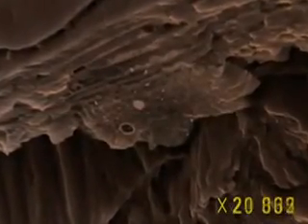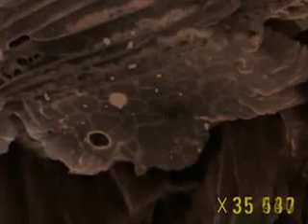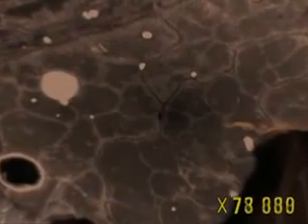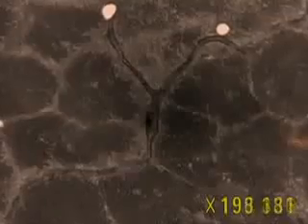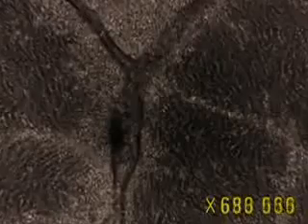The small white spots were caused when the hair was prepared for the microscope. The black groove in the form of a Y marks the separation between three cells. Those rounded shapes inside each cell are spheres of protein fibres. The white flecks inside these spheres are made up of keratin rolled in a spiral. Even at this magnification, it's impossible to see the structure of keratin — our microscope has reached its limits.